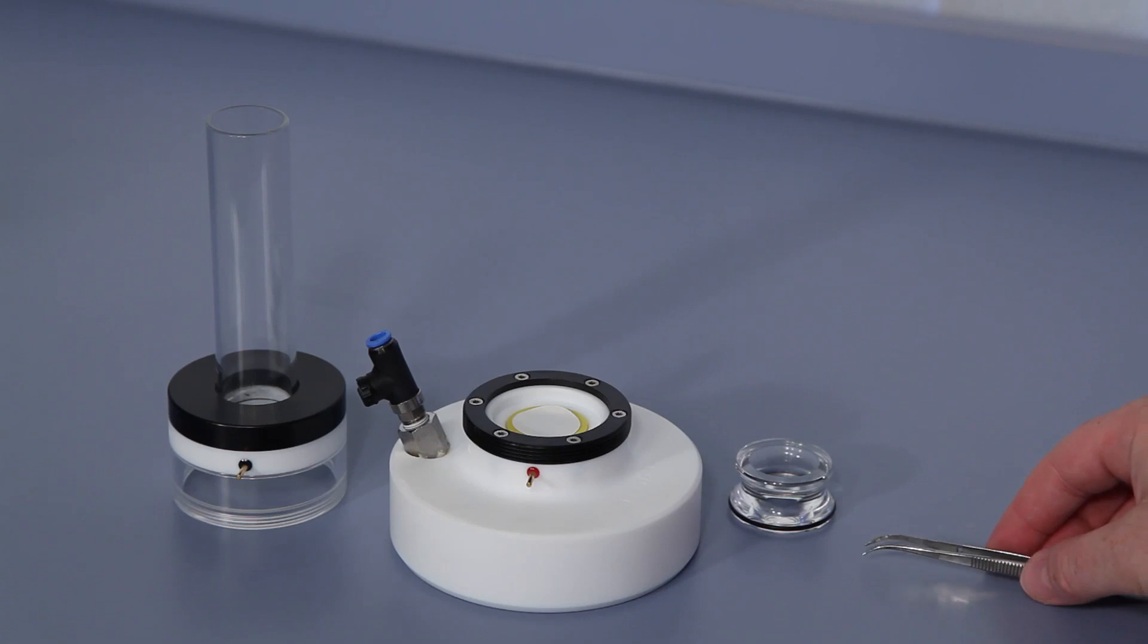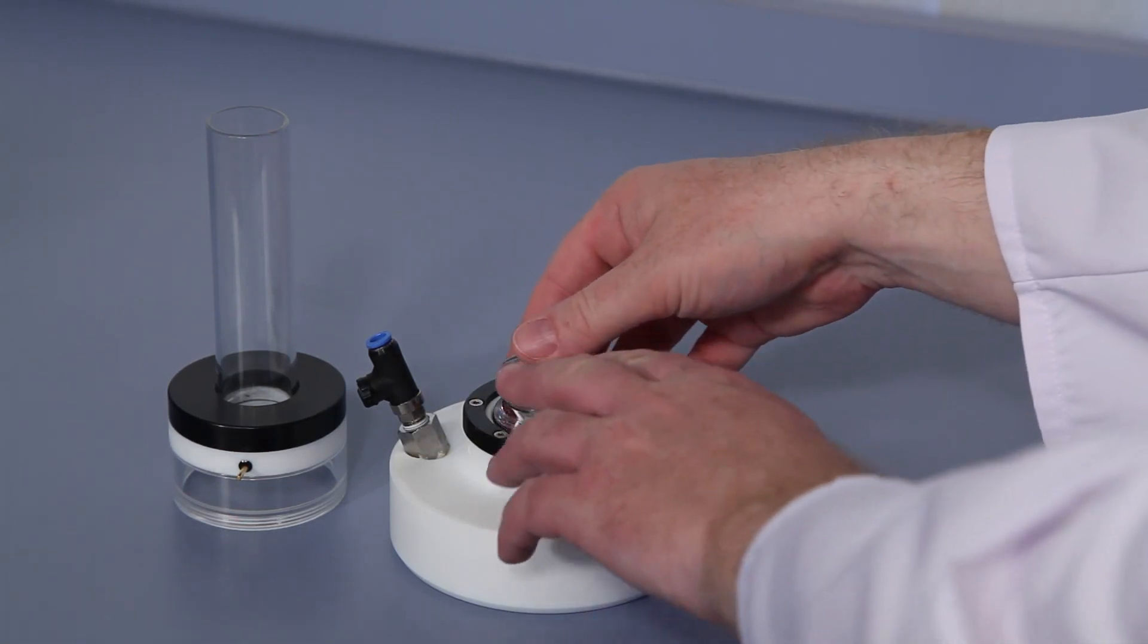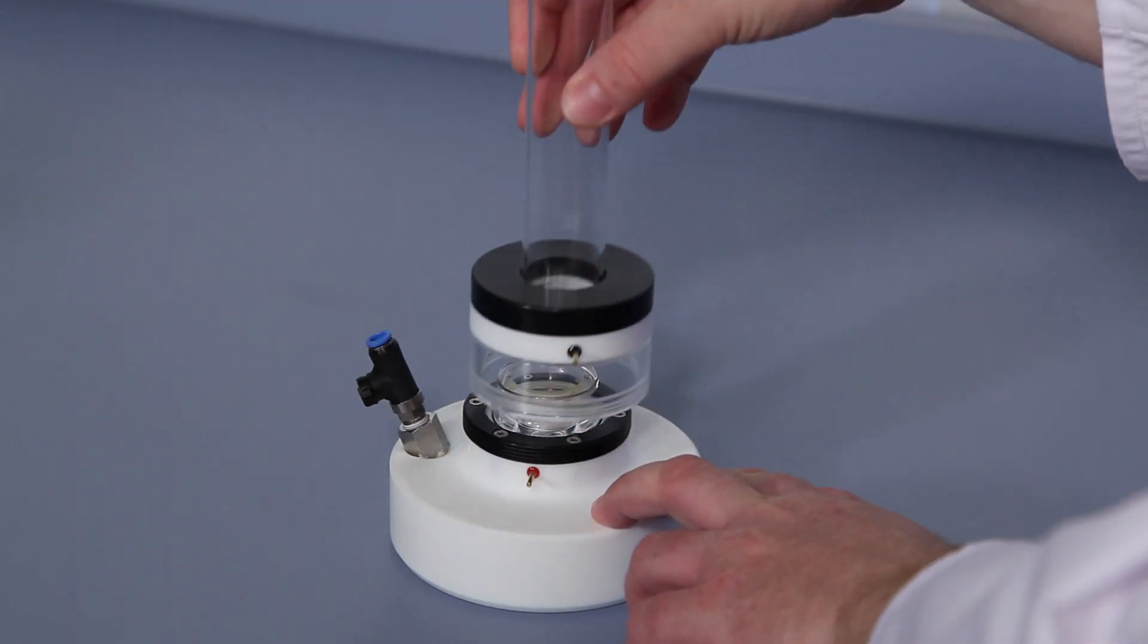As described for the standard measuring cell, push in the adapter piece and screw on the suction tube.